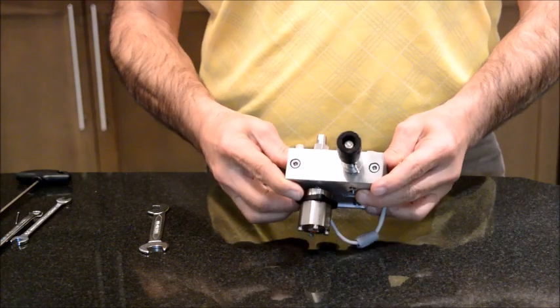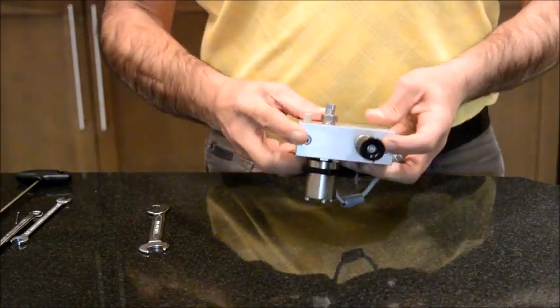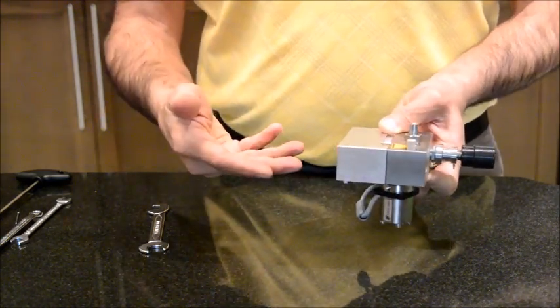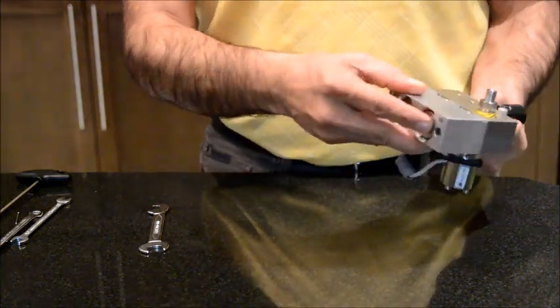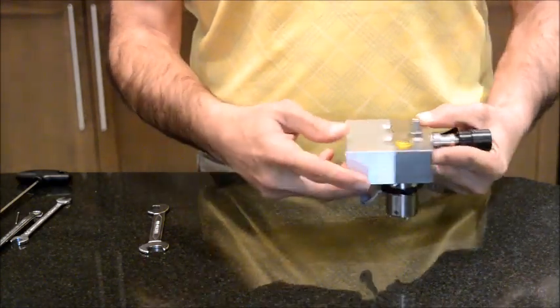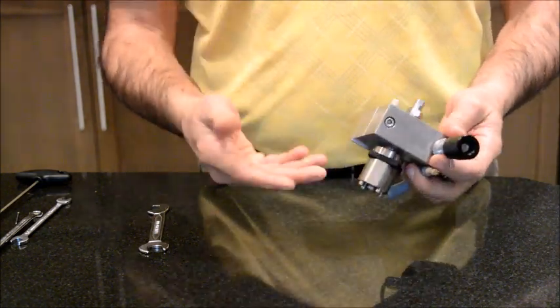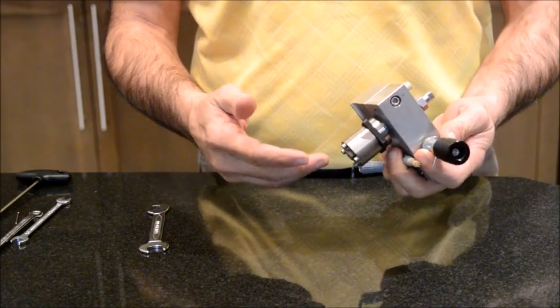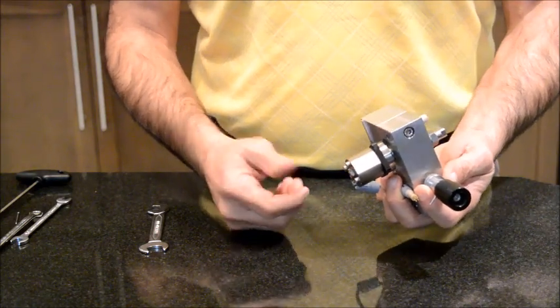What I have here is the Agilent HPLC 1100 pump head. They call it pump head because it is sitting on top of a motor which does the actuation, and this motor pushes these pistons that we see at the back, and then they make the flow go through the HPLC. I will talk about the components of this pump head one by one, and I will talk about the problems that you may face that are related to these components.